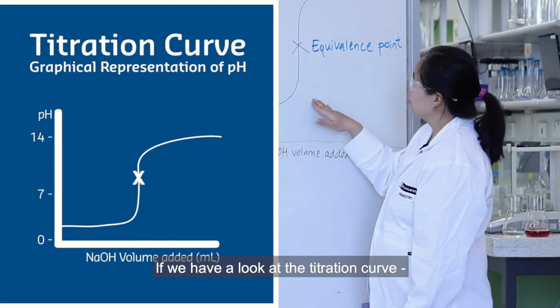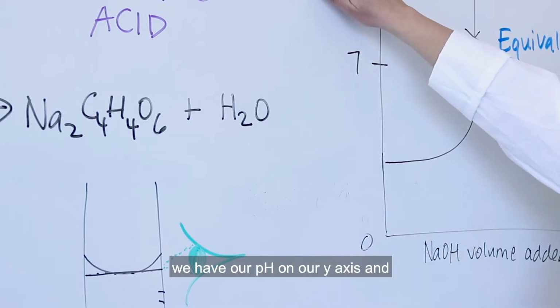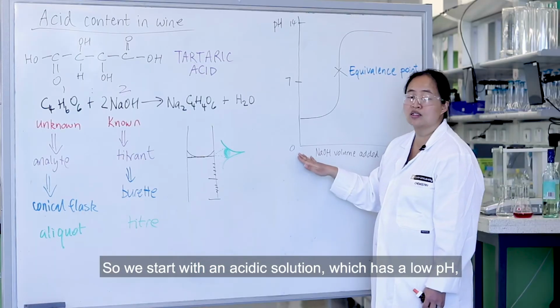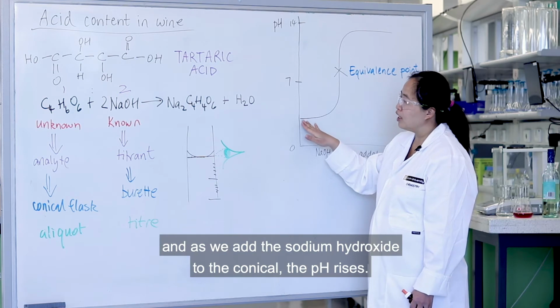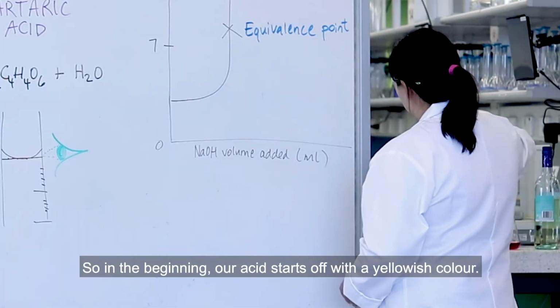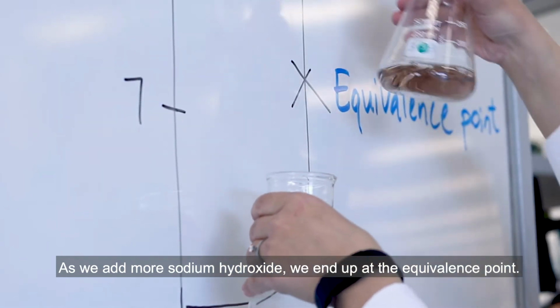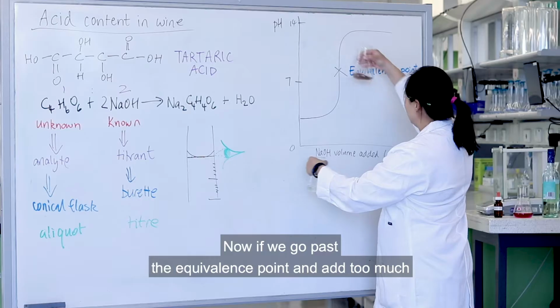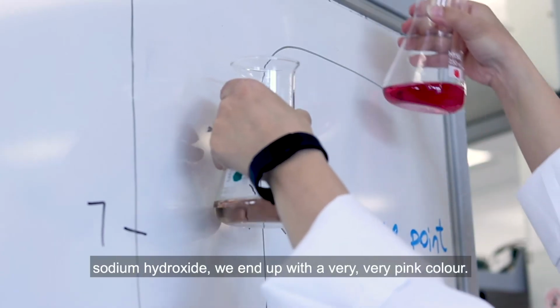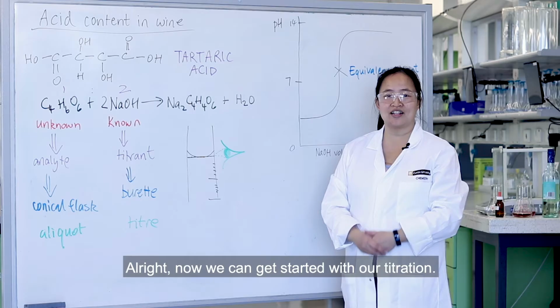If we have a look at the titration curve, you may have already seen something like this before. We have our pH on our y-axis and the volume of sodium hydroxide on our x-axis. So we start with an acidic solution, which has a low pH, and as we add the sodium hydroxide to the conical, the pH rises. In the beginning, our acid starts off with a yellowish colour. As we add more sodium hydroxide, we end up at the equivalence point. Now if we go past the equivalence point and add too much sodium hydroxide, we end up with a very, very pink colour.